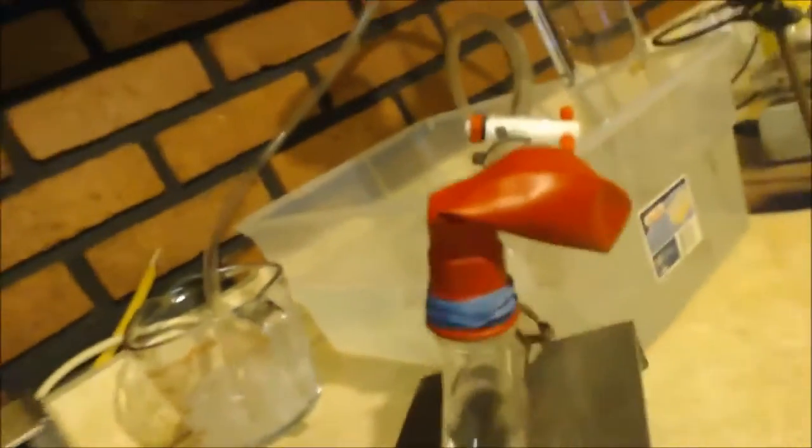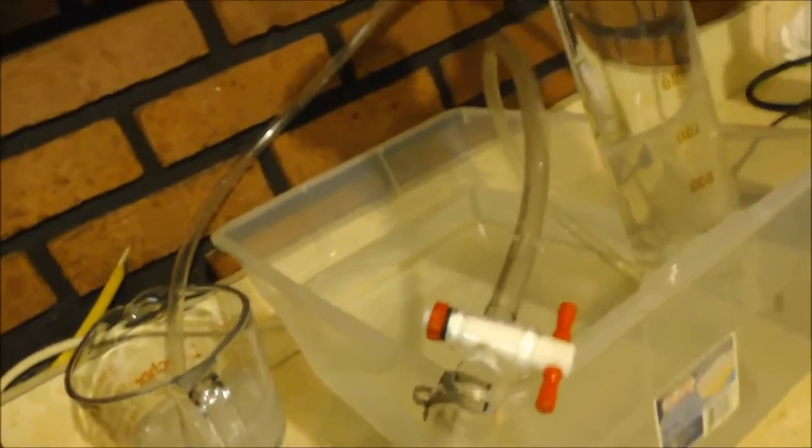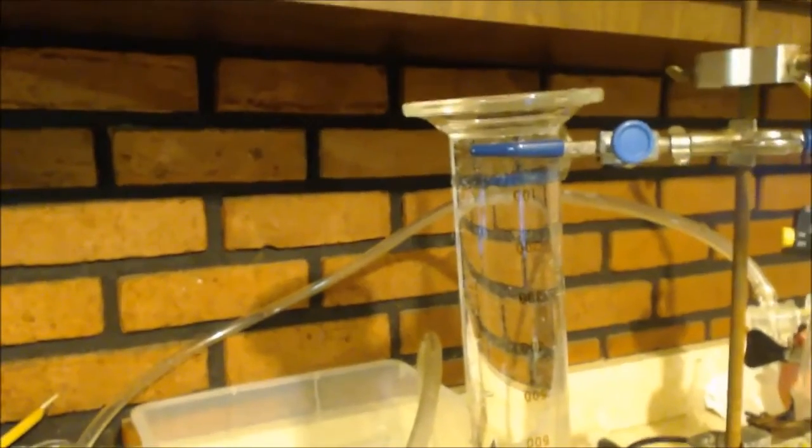Starts out right here. I got my ethanol in there. And then up here, I got my catalyst, that aluminum oxide, right? Goes up the trail, and you get a balloon there, so I can see what's going on, like how much gas is in there, how much pressure is in there. And it goes into that same dealio with the graduated cylinder. It's already filled up with water. There's barely any air in there, a little bit though.